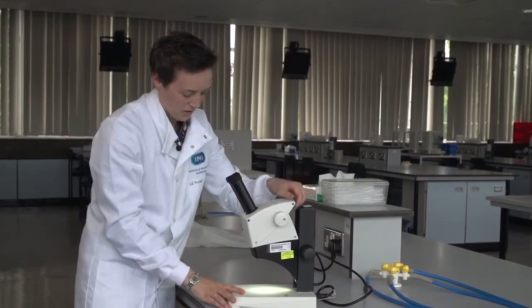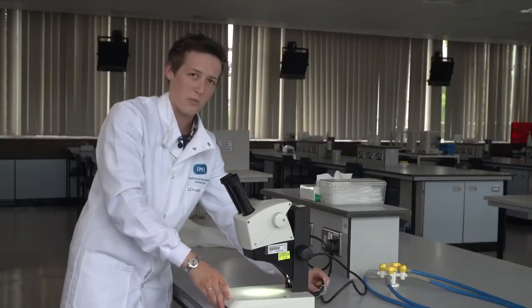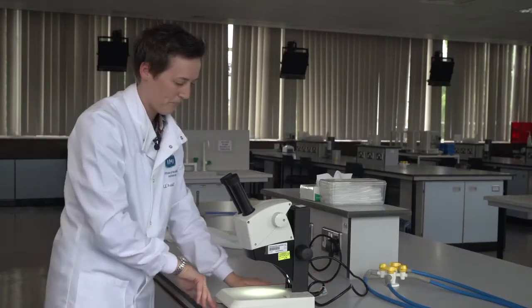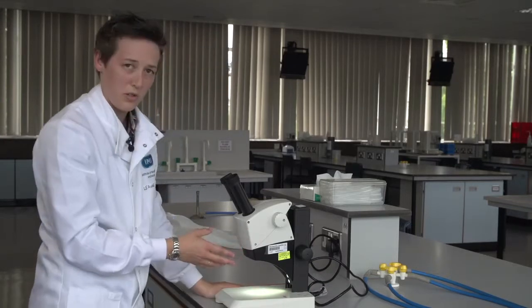If we need to reposition it we just lift and reposition. Don't drag the microscopes across the bench top. So I'll just go through some basic features of this microscope.